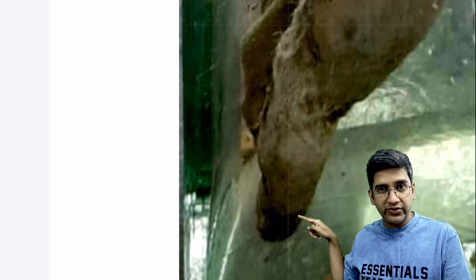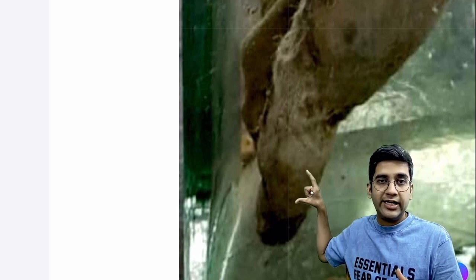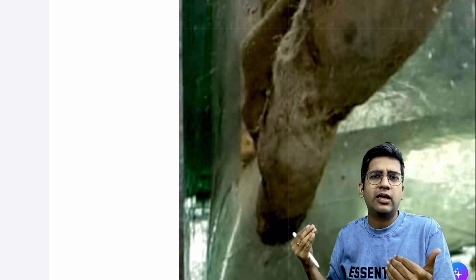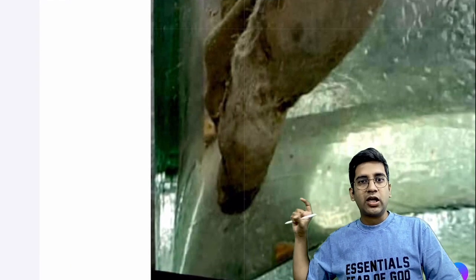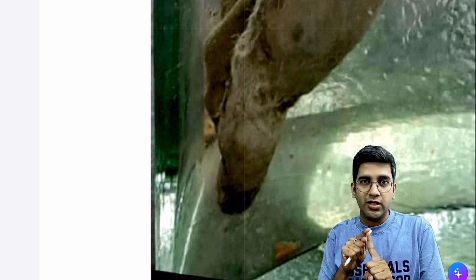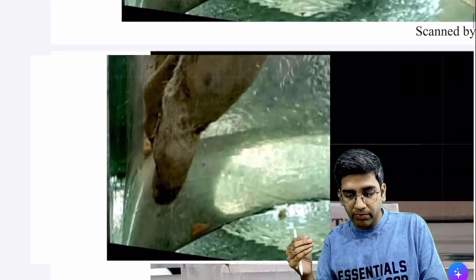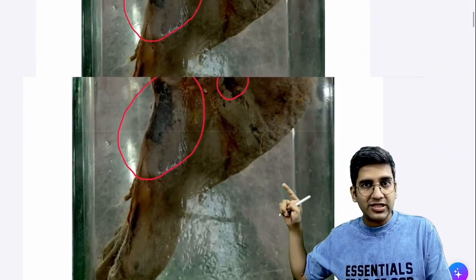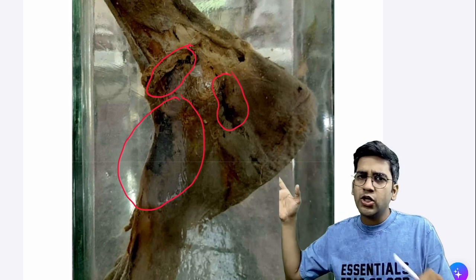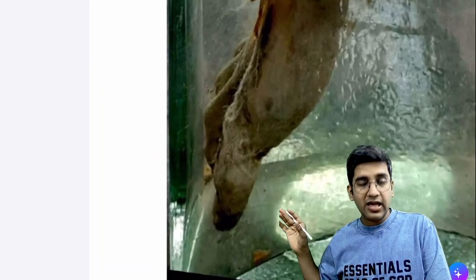The tip of the toe here is completely black in color compared to the proximal part of the great toe, which is not discolored — it looks like a normal toe. So this part is what I would call a gangrene of the foot. The reason I was not convinced to call those black patches gangrene is that there's no end artery in the dorsum of the foot, so those spots may be processing-related errors.